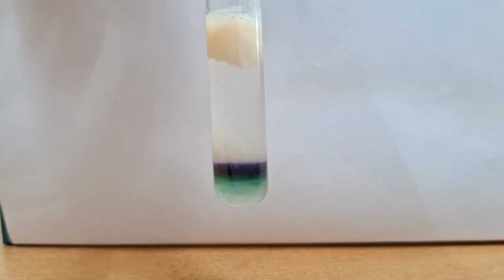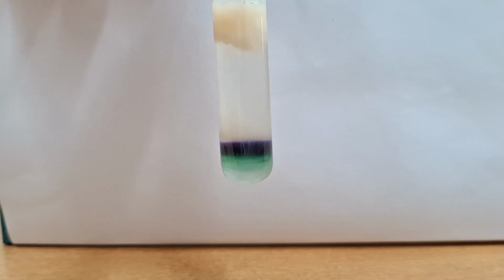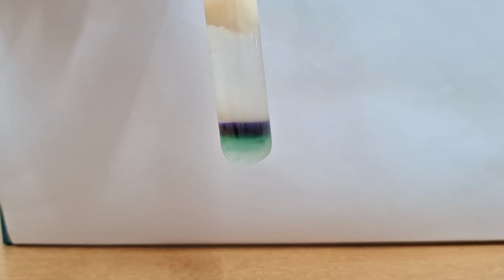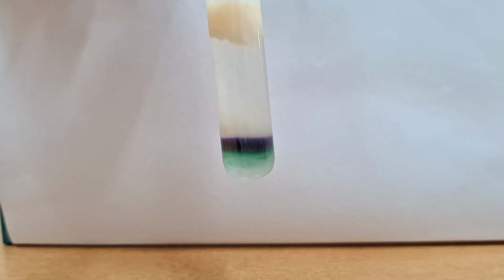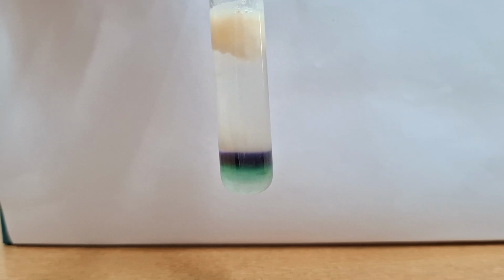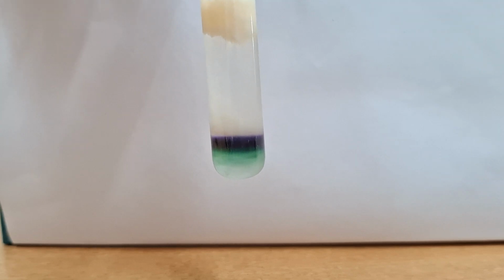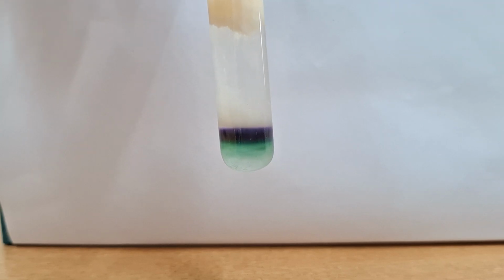Now we are observing the Molisch test. You have to ignore this green color; it is due to contamination of sulfuric acid. But you can see a very nicely formed purple violet color ring at the junction of acid and the solution. The upper one is solution, and the bottom part is acid. This test is nothing new to you; you have performed this test in your carbohydrate practical also.